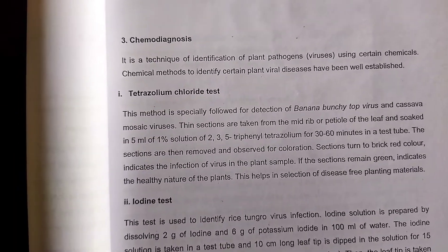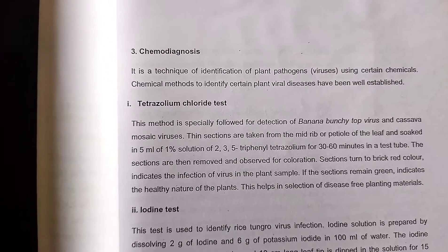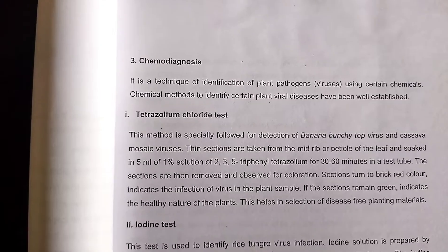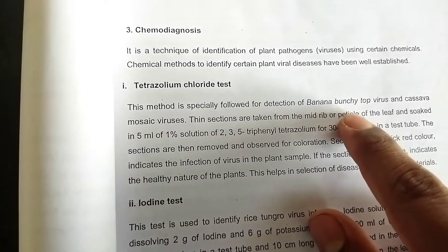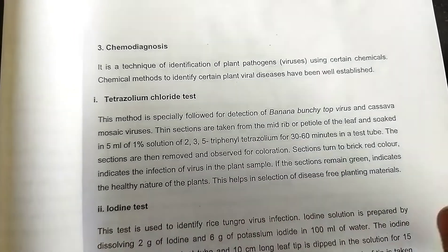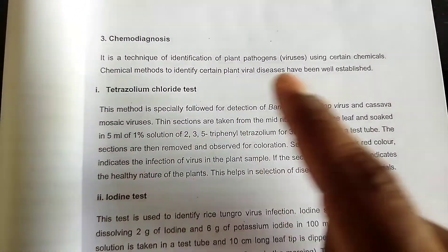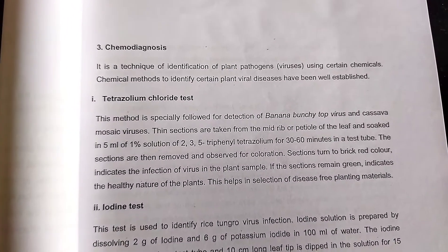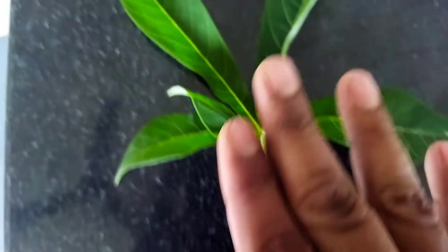The required materials are 2,3,5-triphenyl tetrazolium chloride one percent solution, and a banana leaf sample or cassava leaf sample. We take thin sections from the midrib or petiole portion of the cassava or banana leaf, and soak the infected sample portions in 5 ml of one percent triphenyl tetrazolium chloride solution for 30 to 60 minutes.